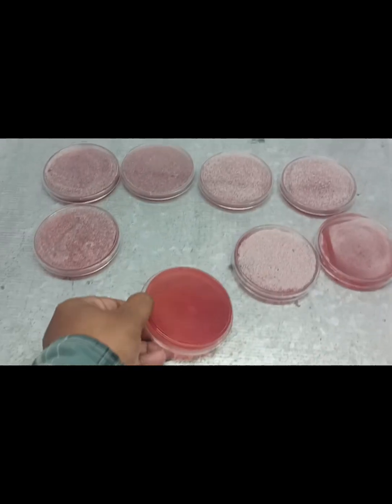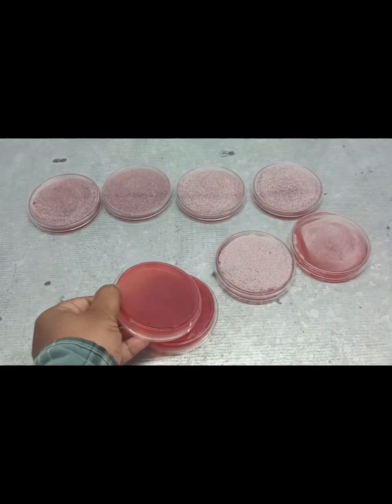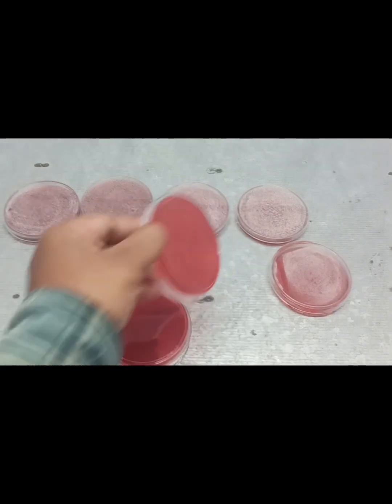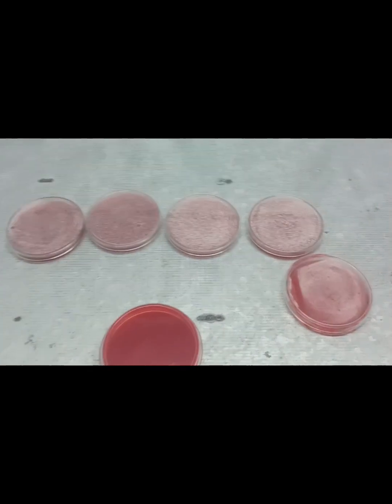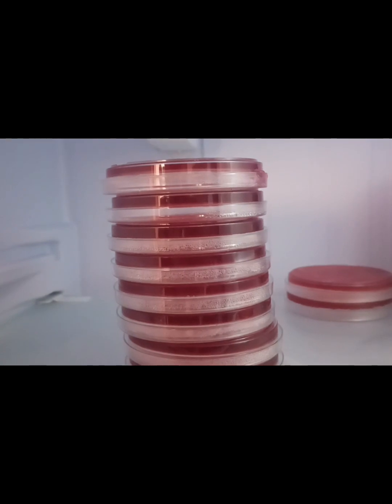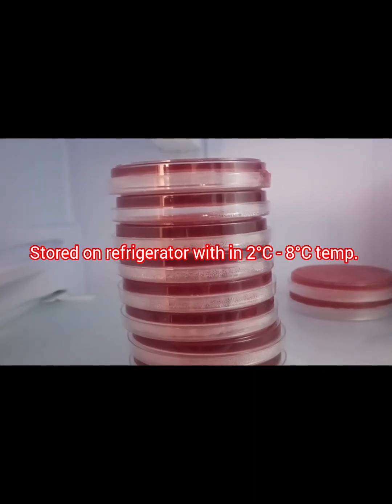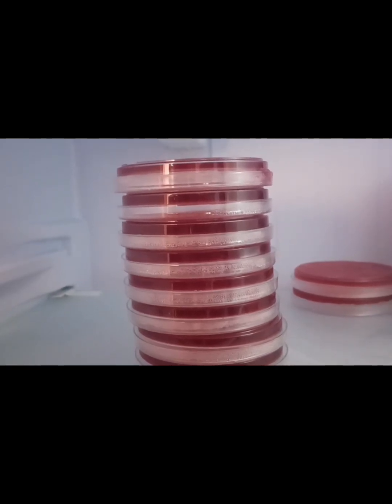We kept the plates like this. We store them in the refrigerator and they should be used within 15 days. Thanks.